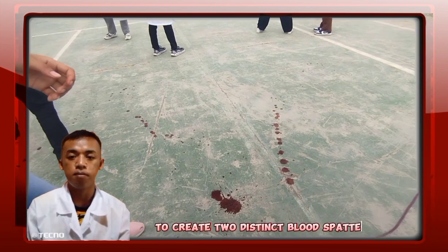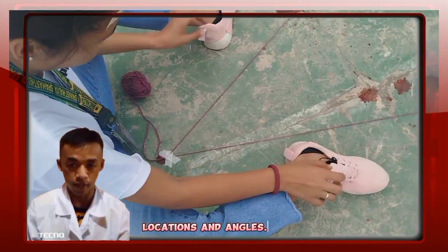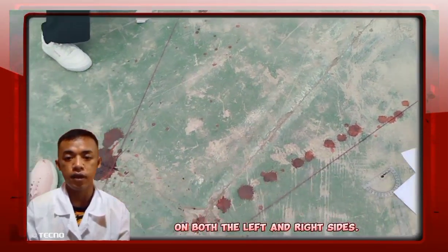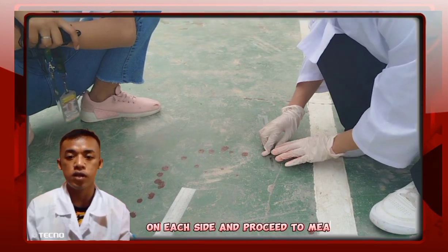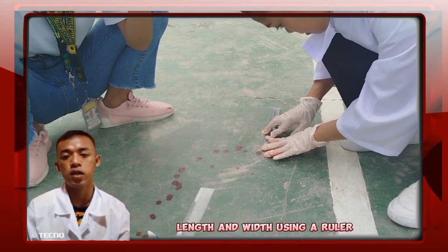To create two distinct blood spatters, we release the suspected blood from various locations and angles. We release the blood on both the left and the right sides. Afterward, we locate the parent drop on each side and proceed to measure their length and width using a ruler.